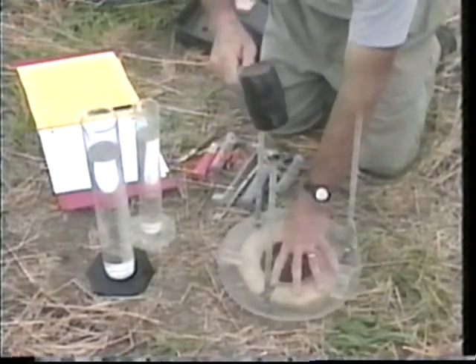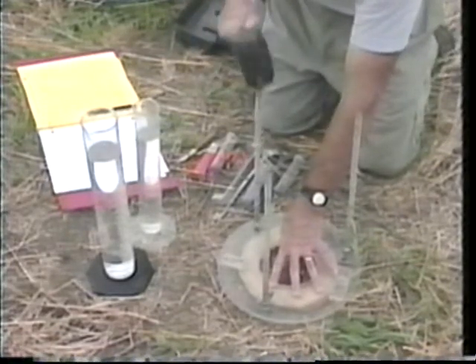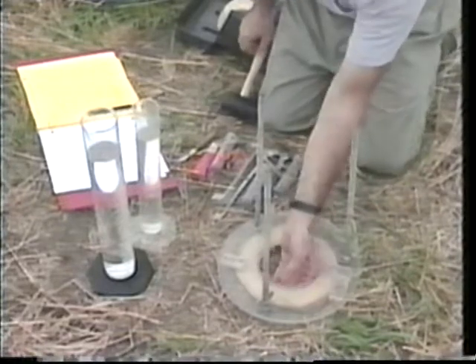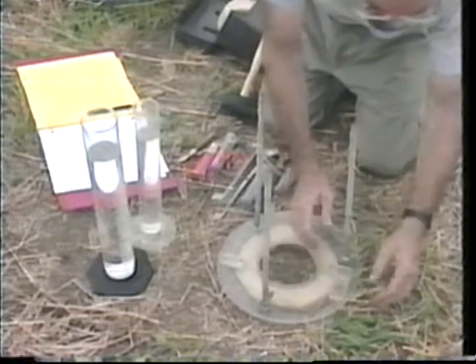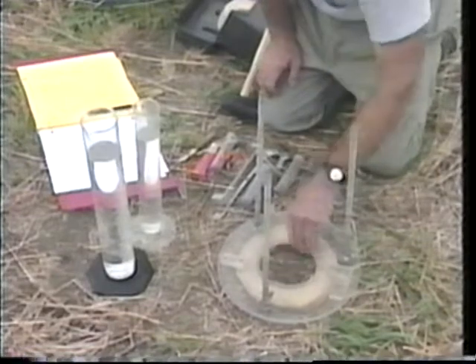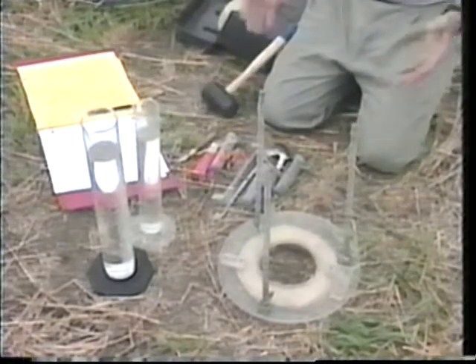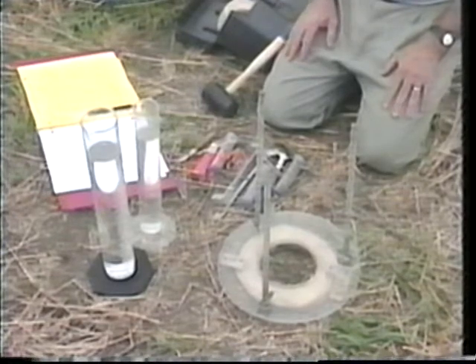There are many ways to do this, but one thing you don't want to do is pound directly on the plastic. I'm pressing it down so I don't pound the plastic. I make sure that the sponge annulus coincides with the opening in the rigid annulus. We've mounted the compliant cavity on the soil surface.